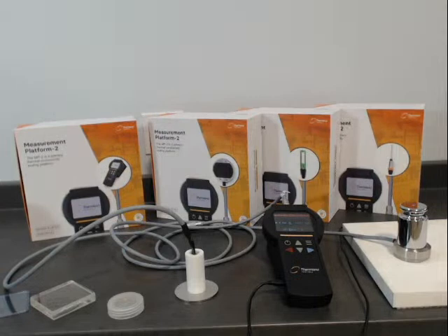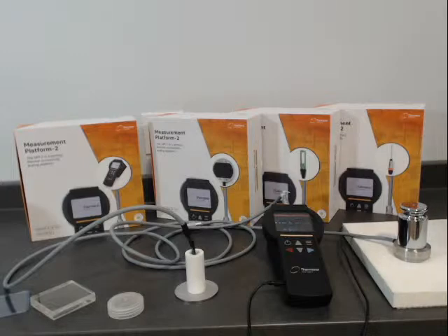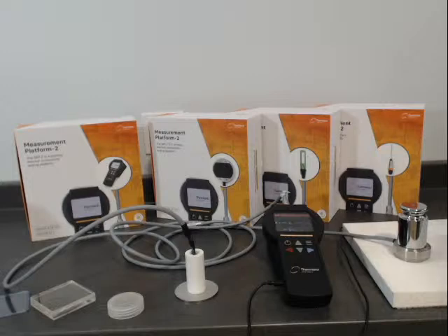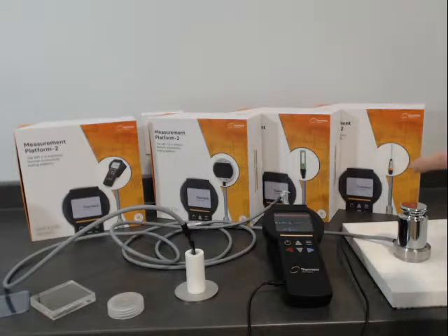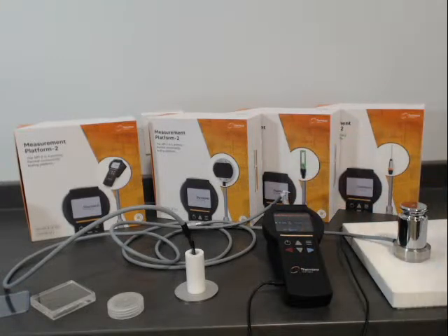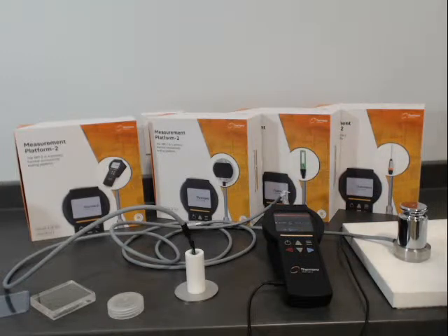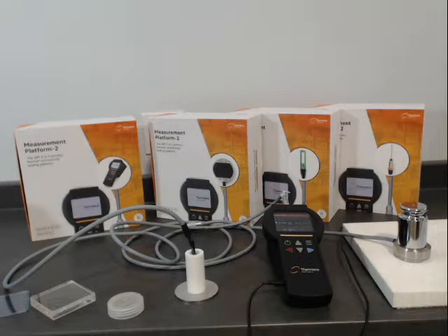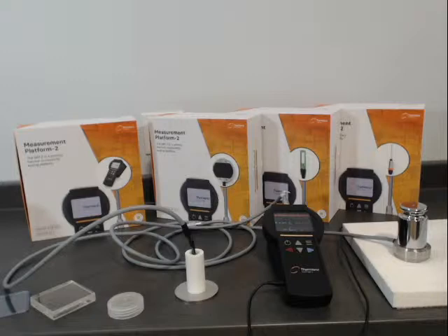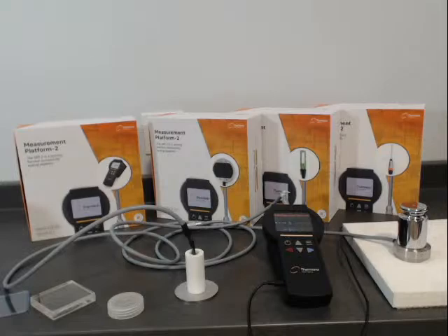So that's the demonstration. If you have any questions, please get in touch with us. There is a question online: if we connect a 100 mm needle, can we get results of thermal conductivity and resistivity on the display? Yes — the unit automatically measures conductivity, and if you toggle through on the device, it shows resistivity as well. Resistivity is just one over conductivity. It does give you those units, and in the software when you download it, you can see that in Excel. Thanks everybody for listening in.